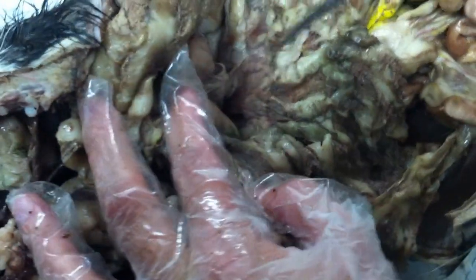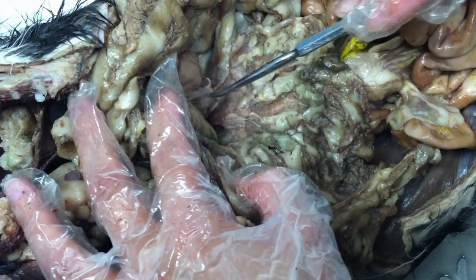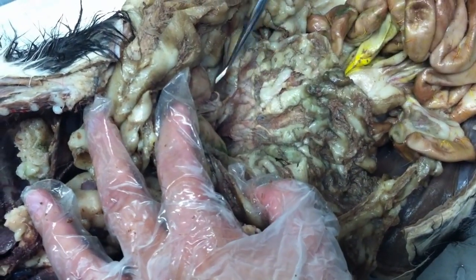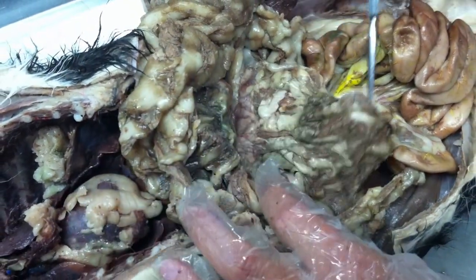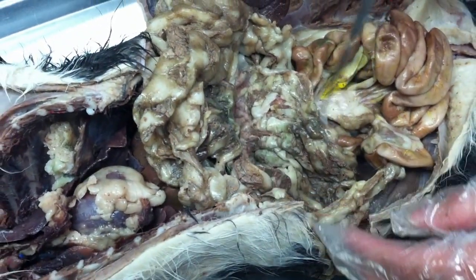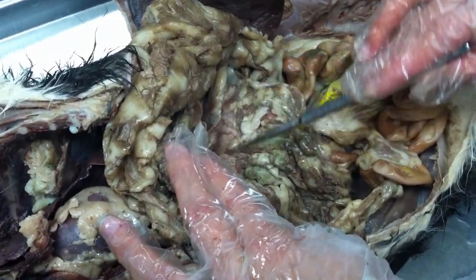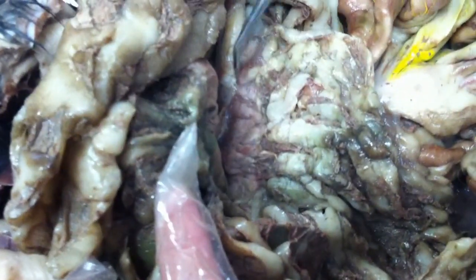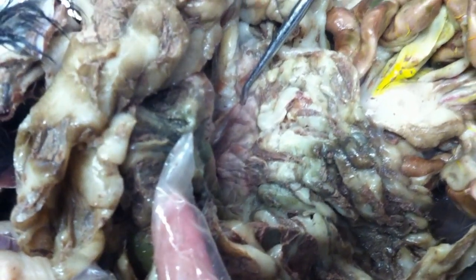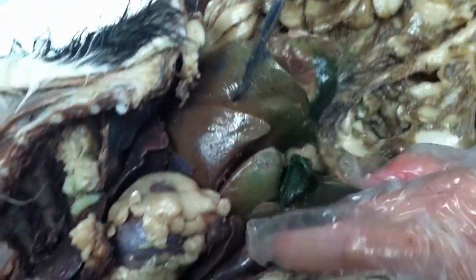Well, let's take a look. This soft tissue is to the back of the stomach. In some cats, it's next to the duodenum. But when you see this texture, you know that's the pancreas. You can see this so clear. Monica, I'm going to ask you to hook me up. Then the liver.